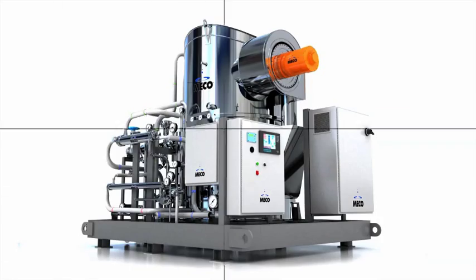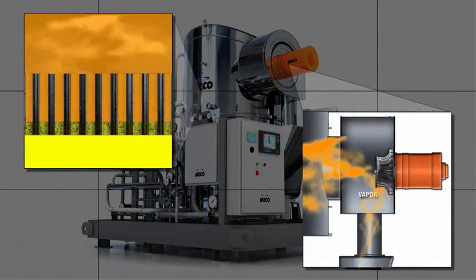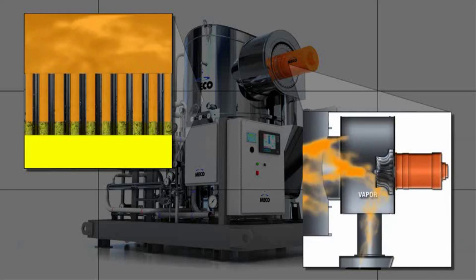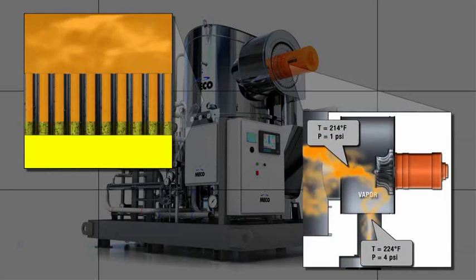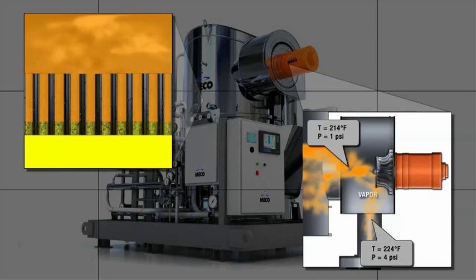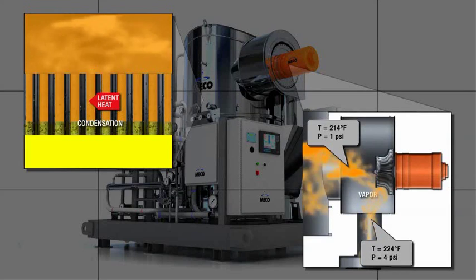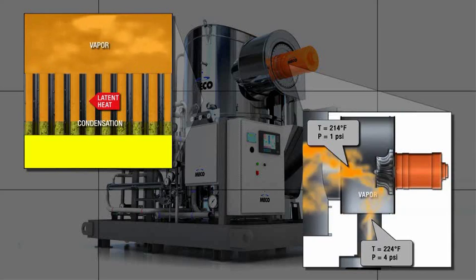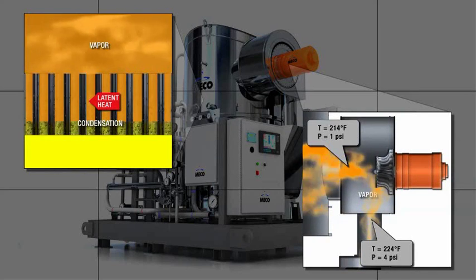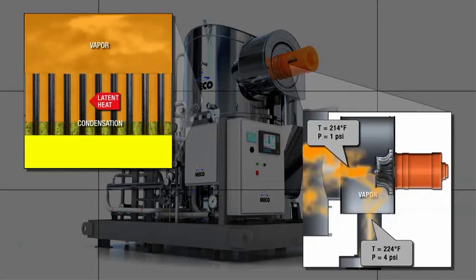Vapor compression is a distillation process that compresses and condenses evaporated feed water to form distillate. Since compression increases both the pressure and temperature of the vapor, latent heat rejected during condensation can be used to generate additional vapor. Conservation of latent heat is the reason for the MECO vapor compression still's high energy efficiency.